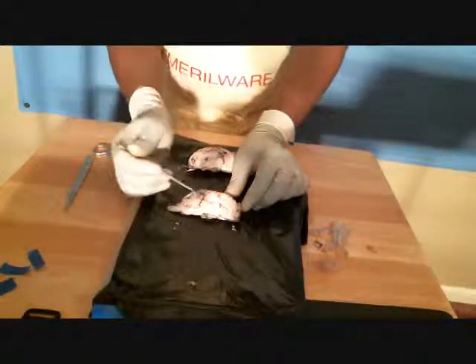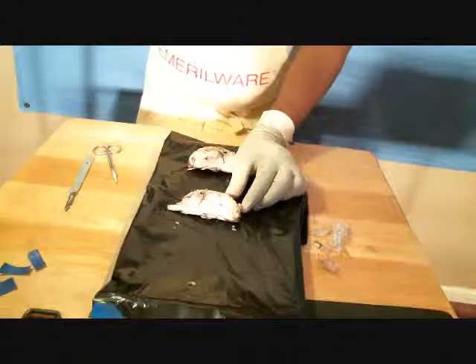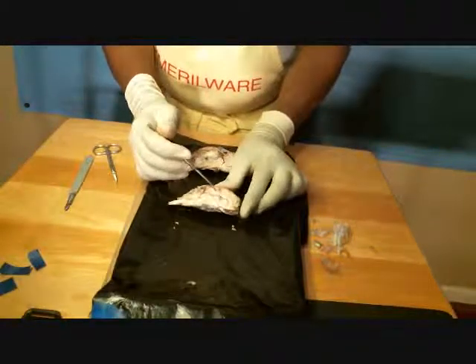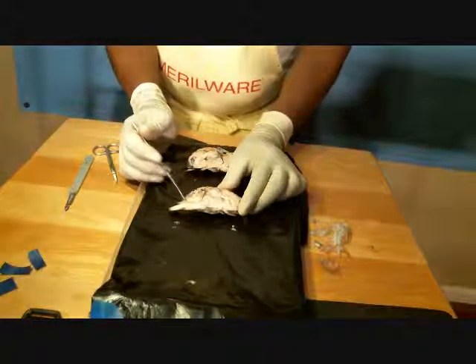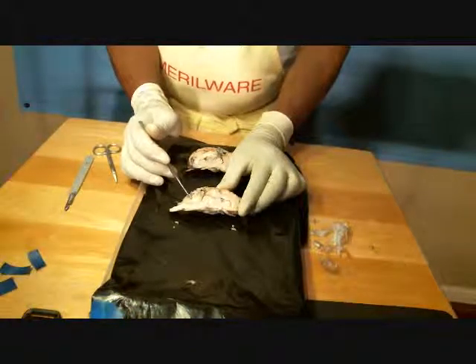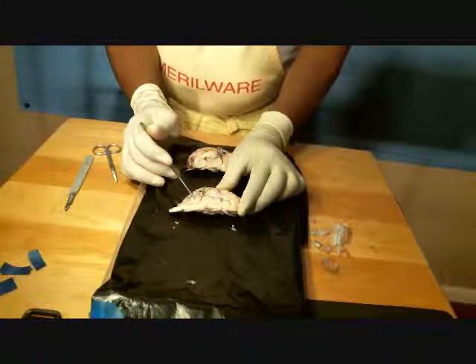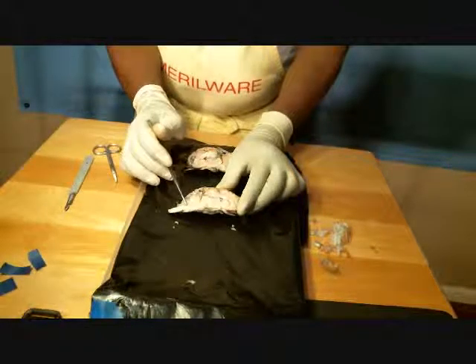Okay, now trying to look at our sagittal view, and we're going to point out the structures that I can see easily. I'll try to point out some of them, quite honestly, once again, I'm confused about and can't find. Over here we have our arbor vitae, and that's a collection of nerves where they all come together at. Below the arbor vitae, here we have the central canal.